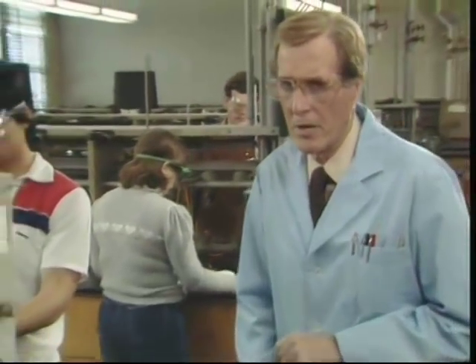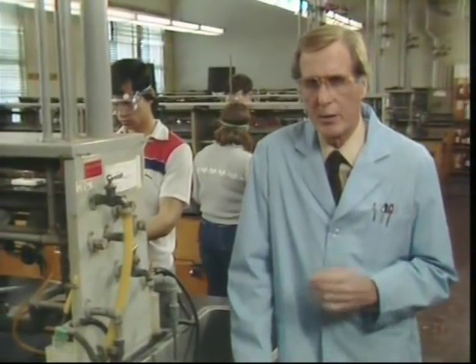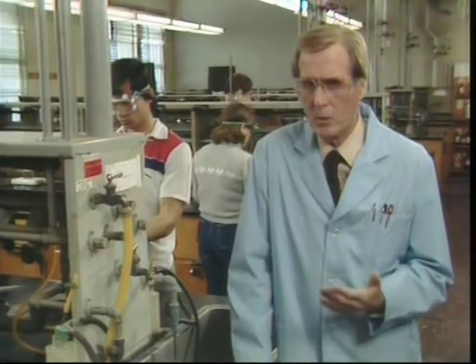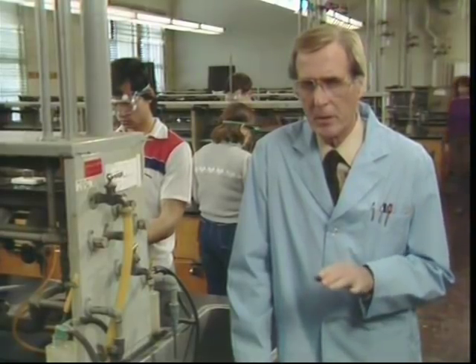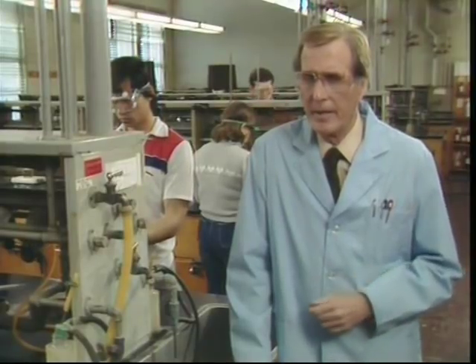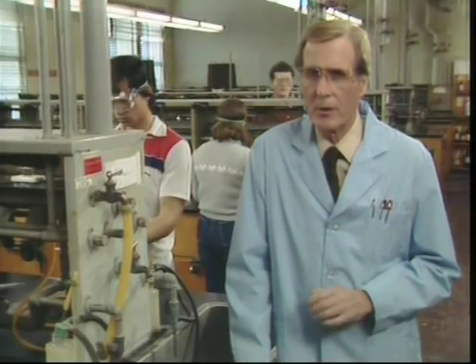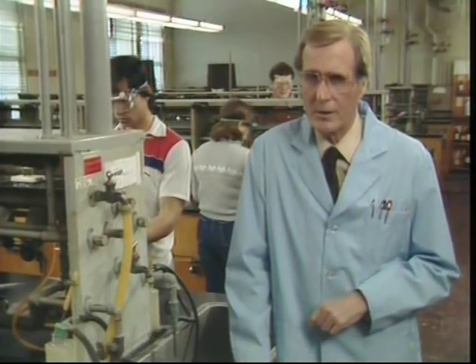If you or your neighbor gets any chemical splashed on you, you must first remove any clothing that has come in contact with the chemical. This is no time for modesty. Temporary embarrassment is far better than permanent scars. You must get the chemicals in the cloth off your body. Your clothes will absorb the chemical, and you may not feel it at once, but it's still there. The chemical will soak through your clothing and quickly be in contact with your skin. Any clothing can be replaced relatively easily and inexpensively. Skin grafts, however, are painful, expensive, and largely avoidable.